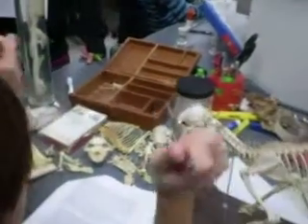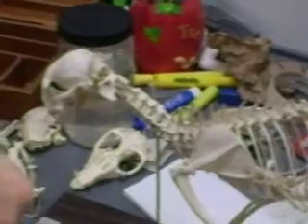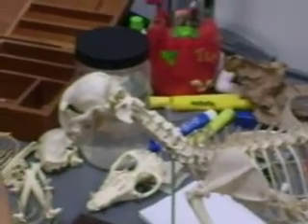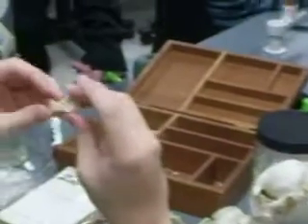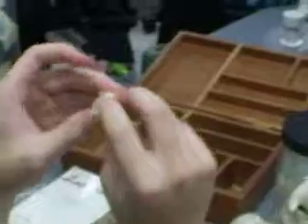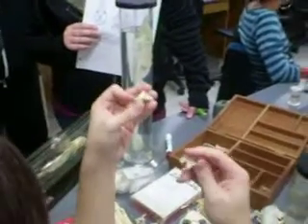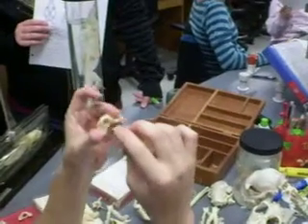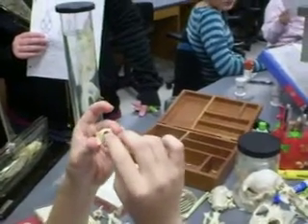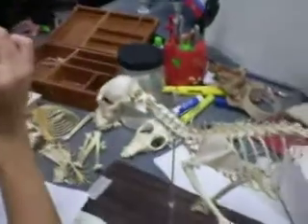So the first and the second cervical vertebra in a cat have evolved into the specialized atlas and axis. The atlas looks like a ring, like this, and the axis is pretty distinguishable. It looks like this, and it articulates like this. Alright, this one's not a good pair, it doesn't fit well together.